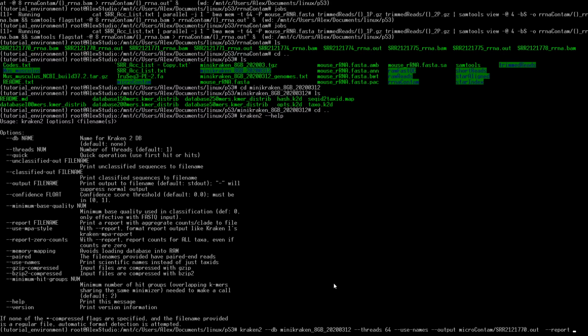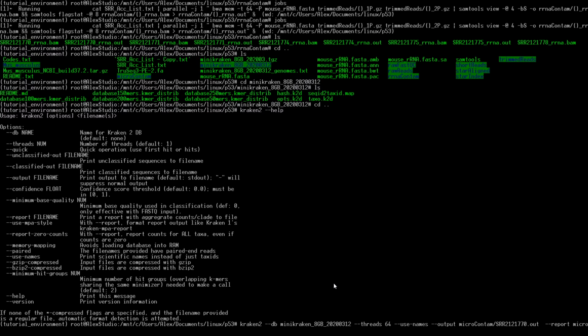Then we'll make a report and we'll tell that to go in the same folder. So microContam with the 770 name .report. Okay. Then we have to let Kraken know that we have some paired end reads. And those paired end reads are the output that we used in STAR. So that'll be mate 1 and mate 2 that are unmapped. So STAR aligned SRR2121770 unmapped, and then mate 1, then we can copy this and tell it mate 2. Okay.